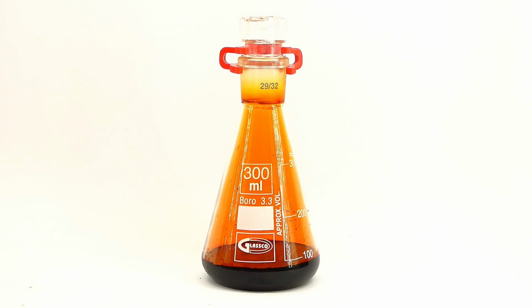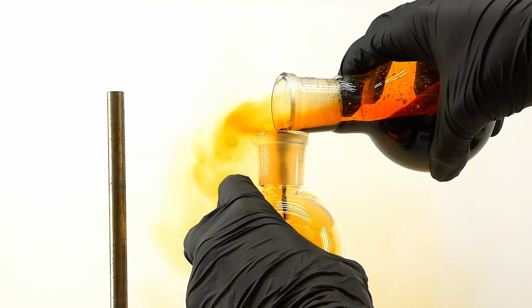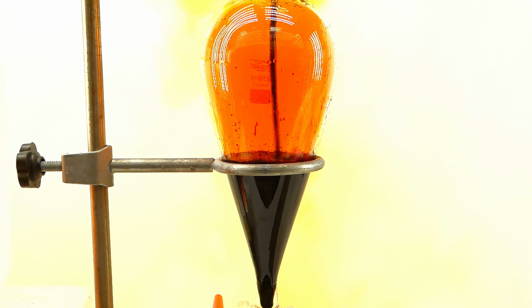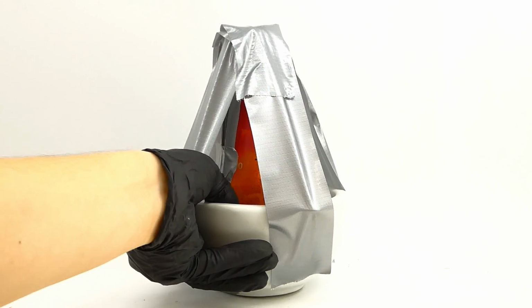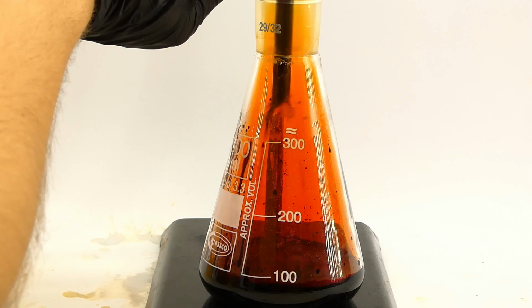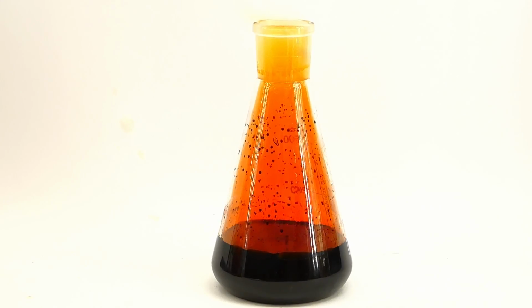That's because for my project I need heaps of bromine and I couldn't make it all at once because of the size of my flask, so I decided to do it in portions, and for the second one I repeated exactly what you've just seen, so I won't bore you with the details. In the end, I was left with around the same amount of acid-washed bromine as before, so I combined it with the first batch, which has been chilling outside for the past day in this contraption made to prevent the bromine from escaping, and now I have a decent amount of some pretty pure bromine.